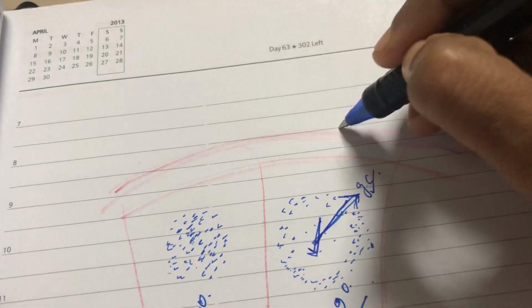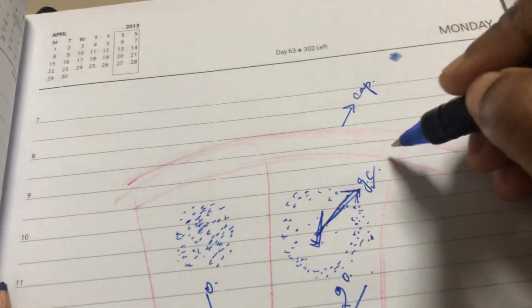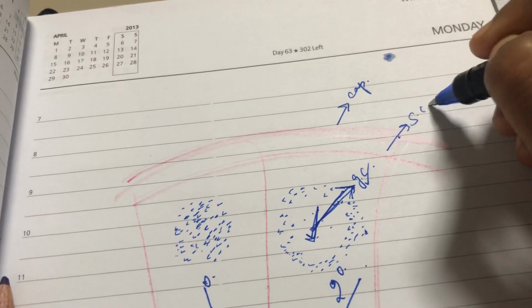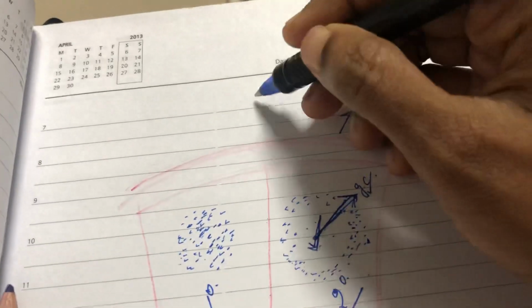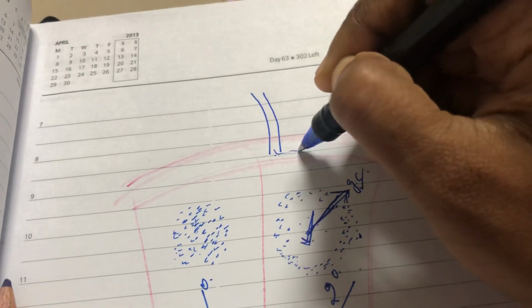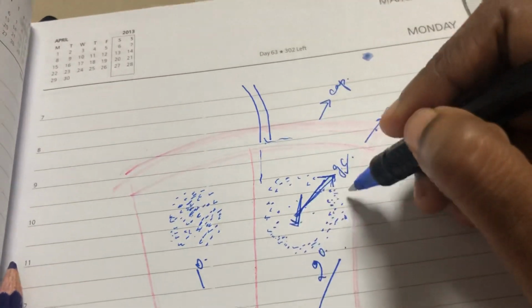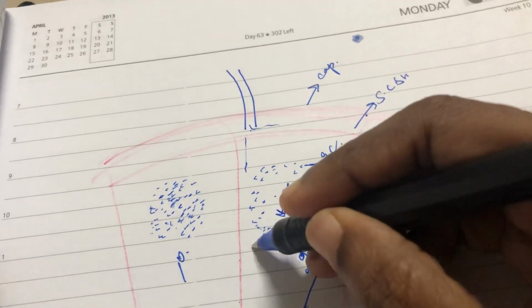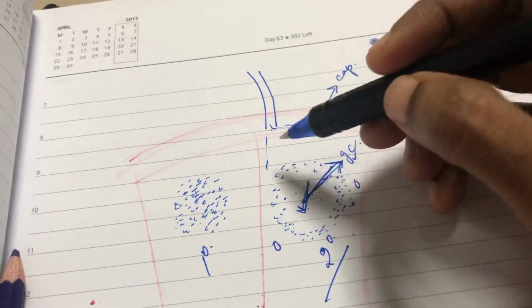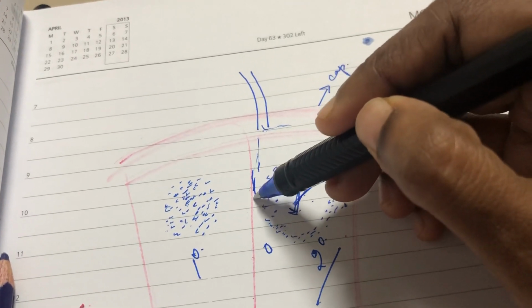So one by one we will come. Number one is the capsule. The capsule is a dense connective tissue. Beneath that you have the subcapsular sinus. From here the afferent lymphatic ducts come and the lymph enters the subcapsular sinus. From here it enters the cortex. Here you also have cortical sinuses, but they are not visible, and the lymph passes via the trabeculae. I said the trabeculae are a road.